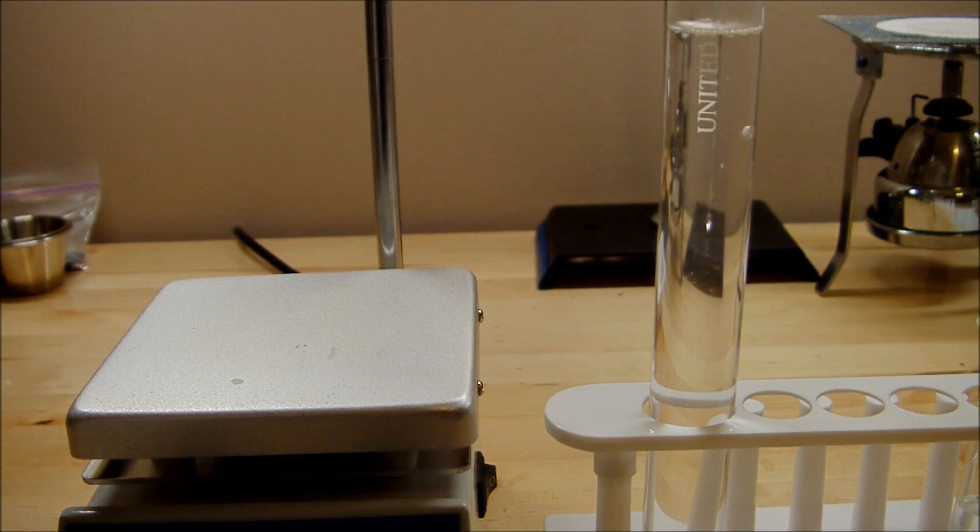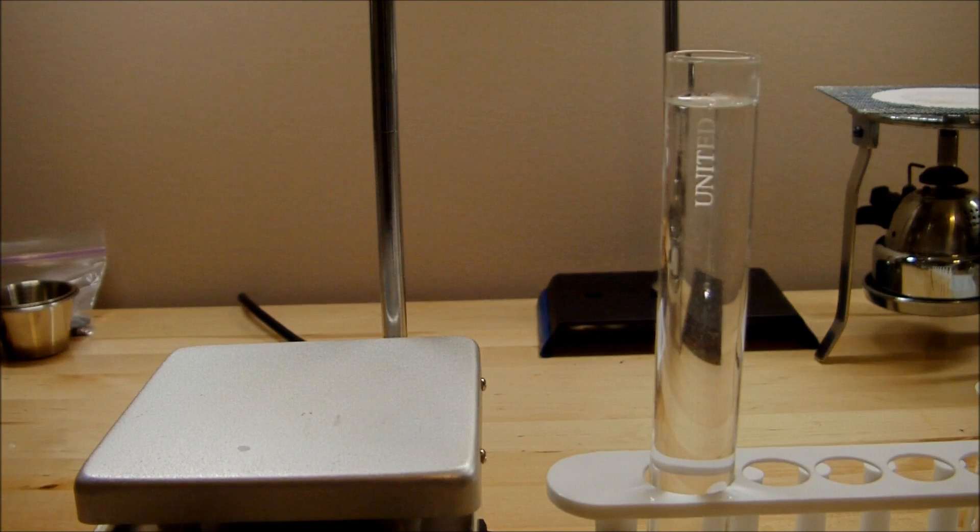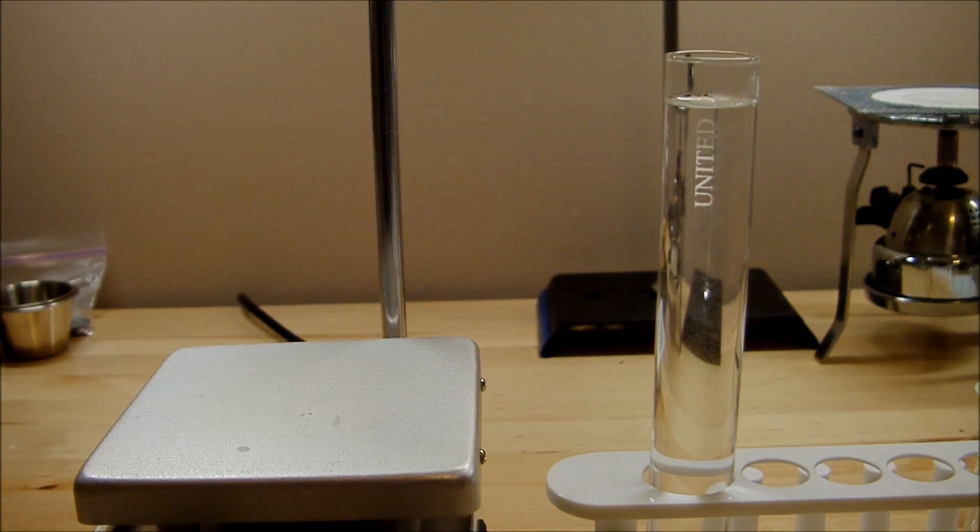The final step of this is to seal the test tube. I'm going to use a stopper and some electrical tape. But I don't want to do that until the thing has cooled down to room temperature. Because I've done this before, and if you seal it before it cools down, it sets up a pressure differential, and that's actually caused the test tube to crack. So I'm going to wait until it cools down to seal everything up.